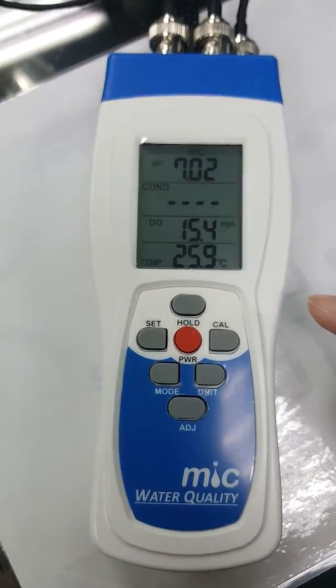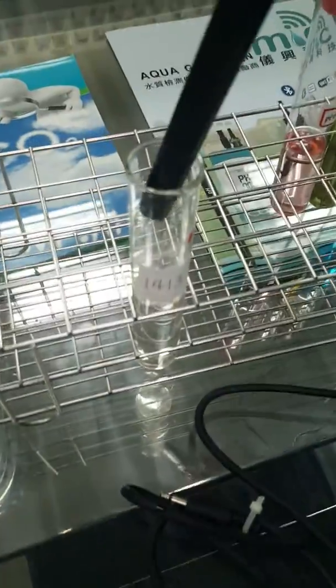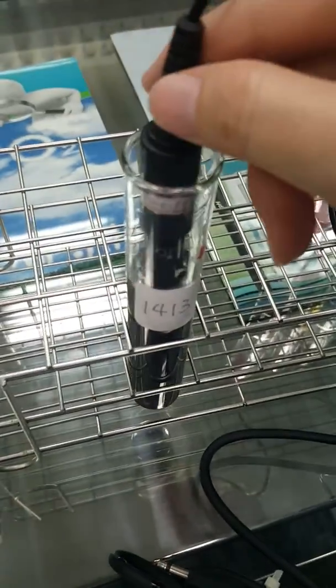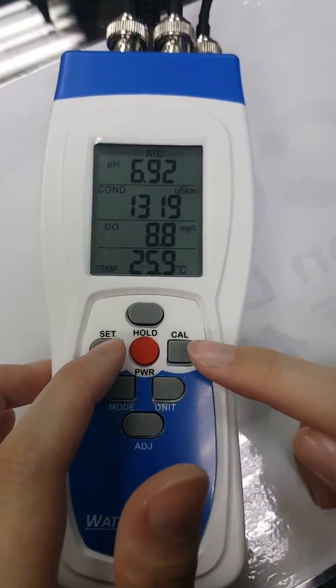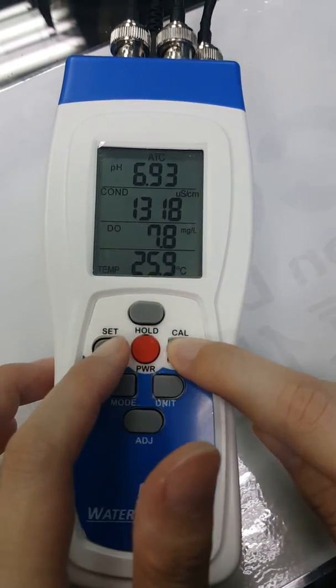Now immerse the conductivity electrode into the 1413 solution. Then press the set button and the calibration button together.